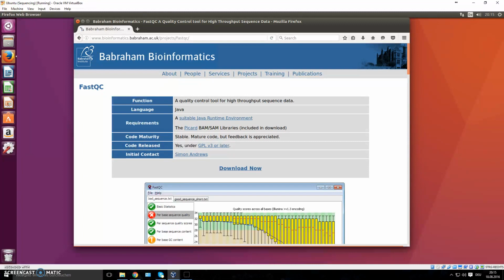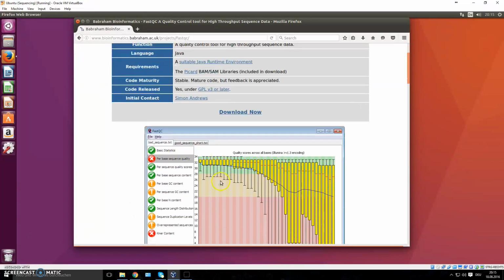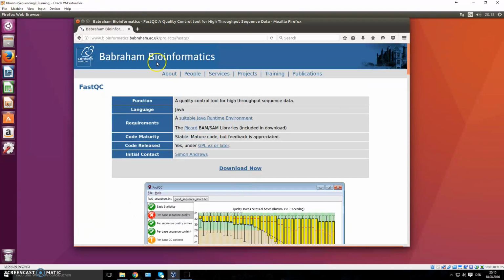Now, we want to discuss how to actually analyze that. And the most widely used program is called FastQC. And it's very nice because it has a graphical user interface. You see a picture here. So you can download this program by just typing FastQC into Google, or you can quickly write down the URL here, but it's too long.